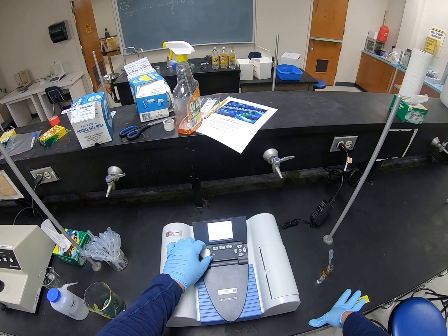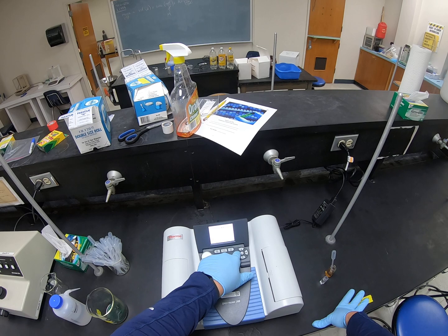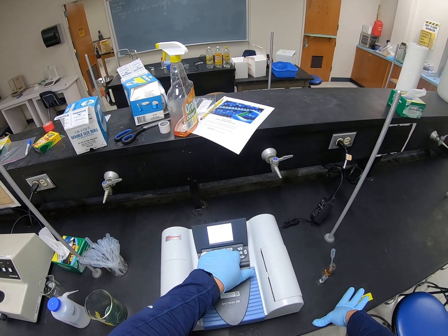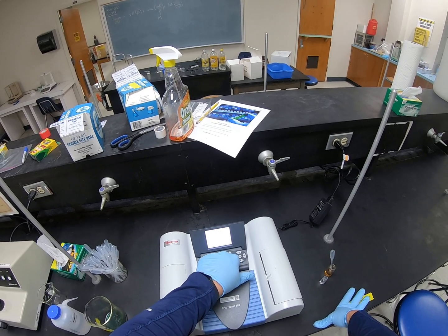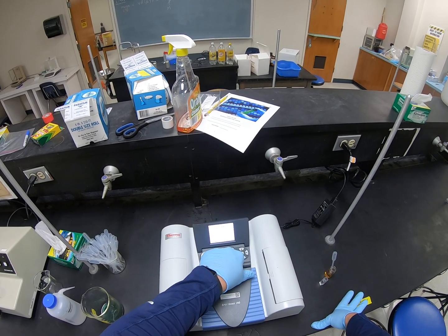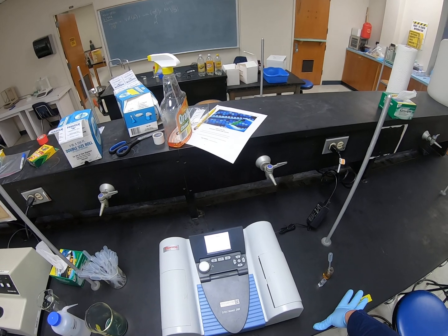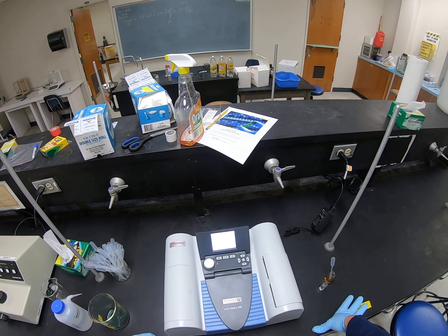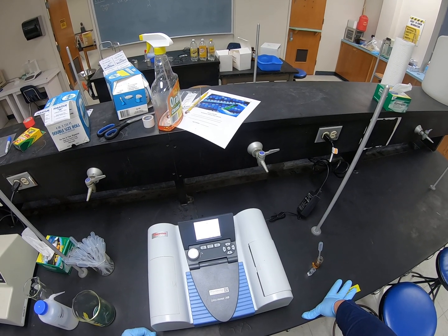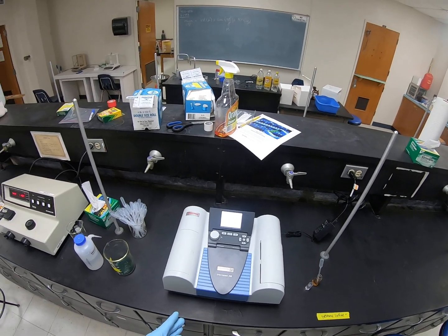So if I dial to find out where that peak is, I'm going to take my green little cursor, and I'm going to find out where the center of that peak is. All right, now our lab write-up says that it should be done at 447, and I don't think that's the number we're going to use, so we're going to adjust it. The instrument shows that that peak is the largest at 462, so we're going to modify our experiment and make the measurement at 462. Okay, so that looks like it's ready to go at 462.